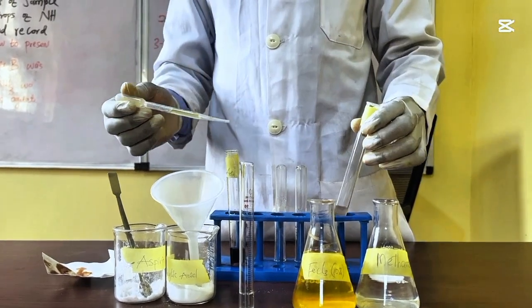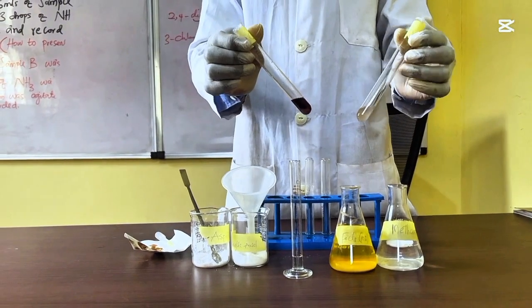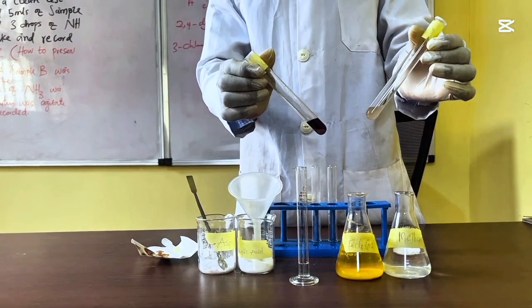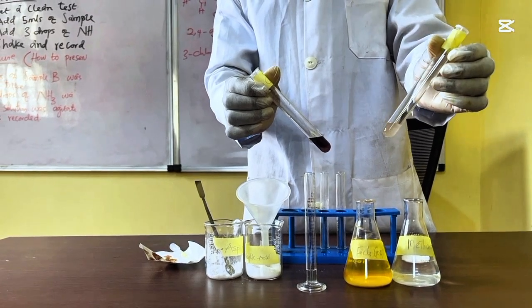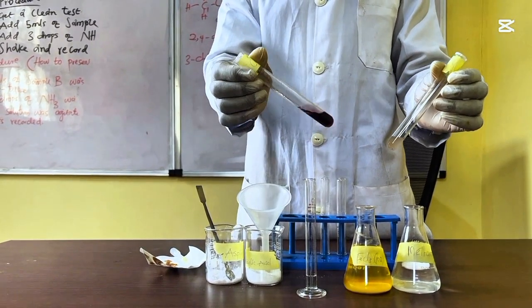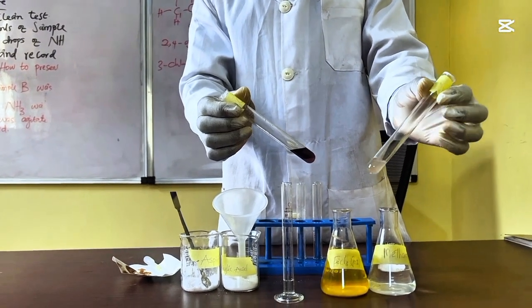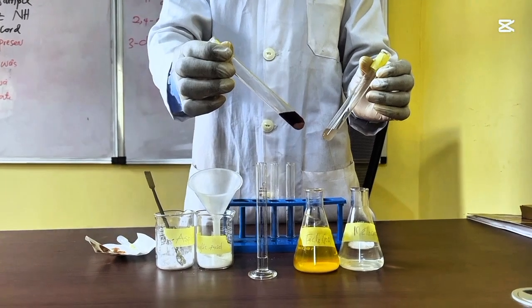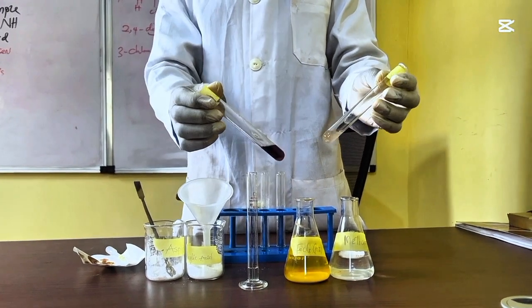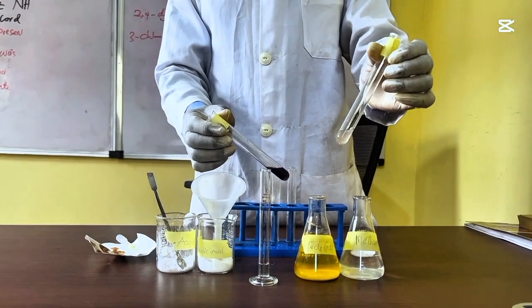And if you compare these two together, you see that this color remains permanent, while this is kind of light. So this tells you that your sample is kind of pure in a way, while this is not pure. This contains a lesser or no amount of salicylic acid, while this has a much greater amount of salicylic acid.